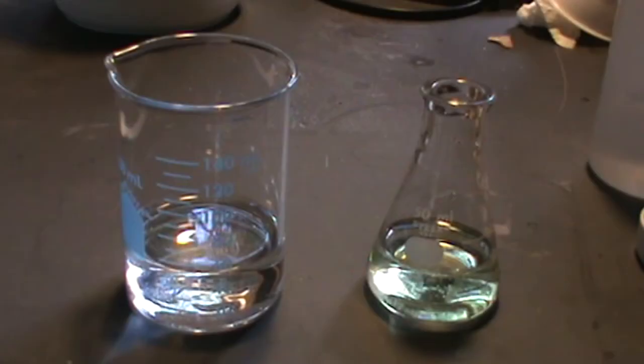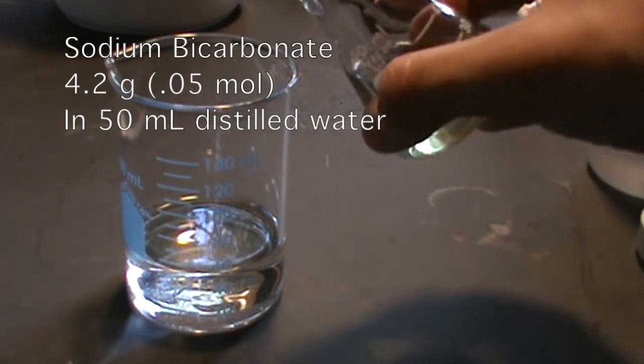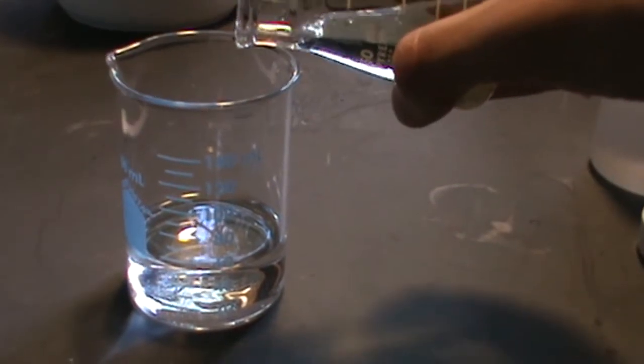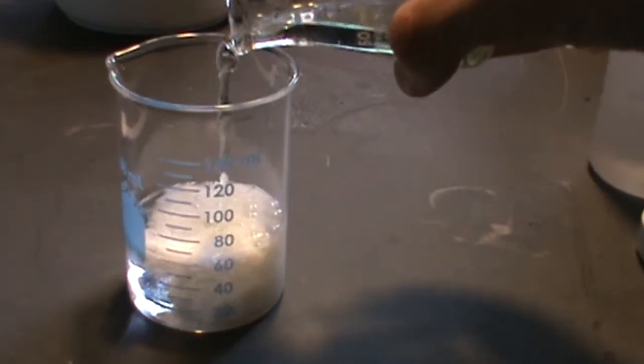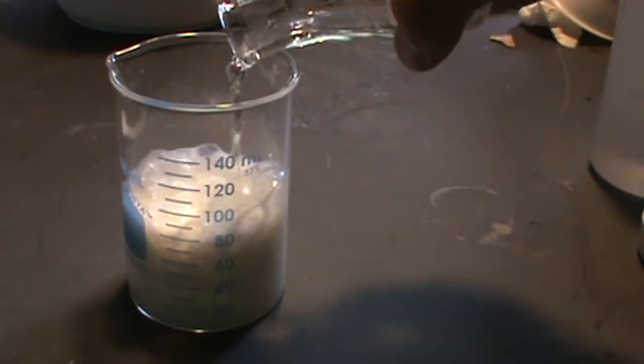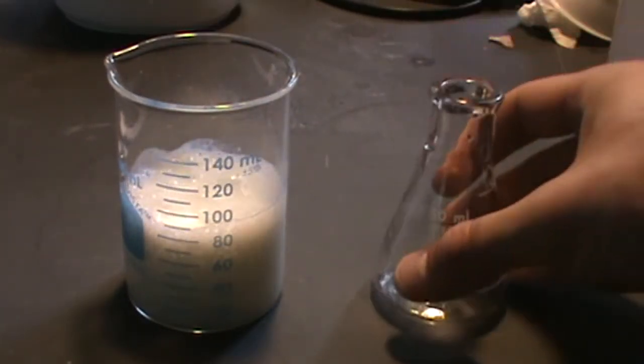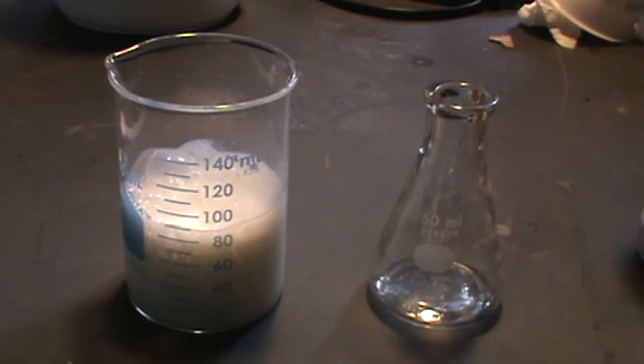What's left after filtration is a clear green solution. Upon being added to a solution of sodium bicarbonate, a white precipitate instantly forms. I think that the green color of the solution may be due to praseodymium being present.